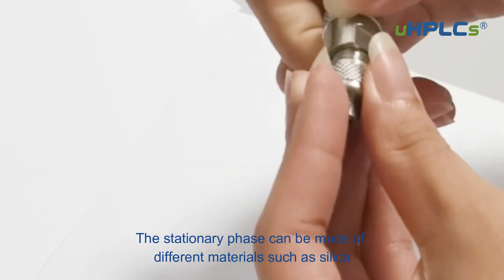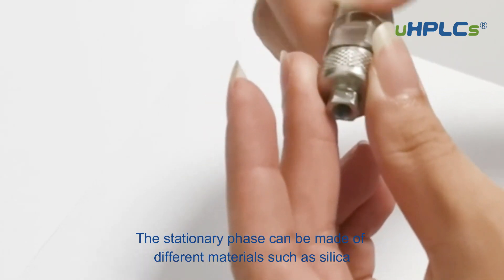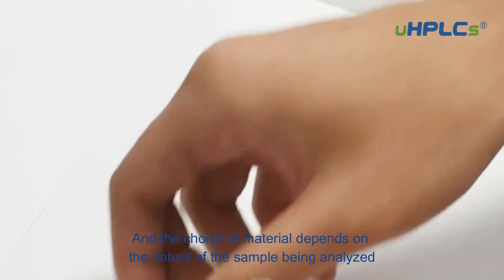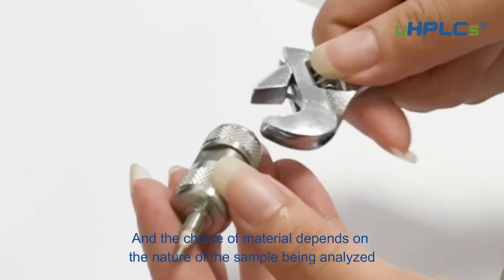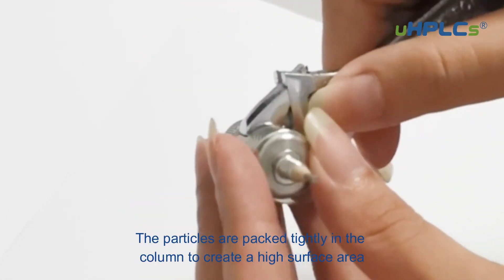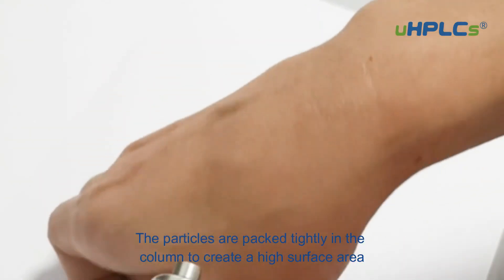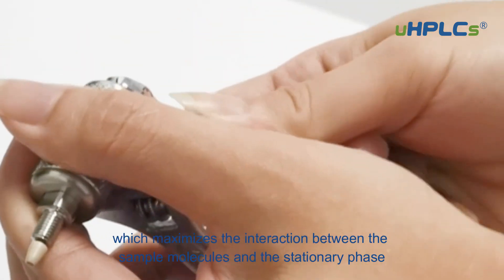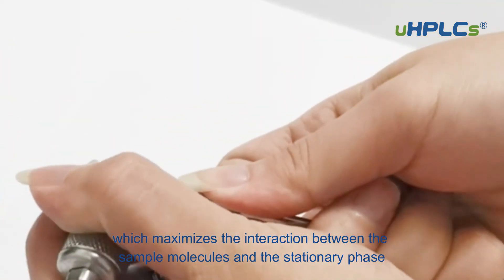The stationary phase can be made of different materials, such as silica, polymer, or carbon, and the choice of material depends on the nature of the sample being analyzed. The particles are packed tightly in the column to create a high surface area, which maximizes the interaction between the sample molecules and the stationary phase.